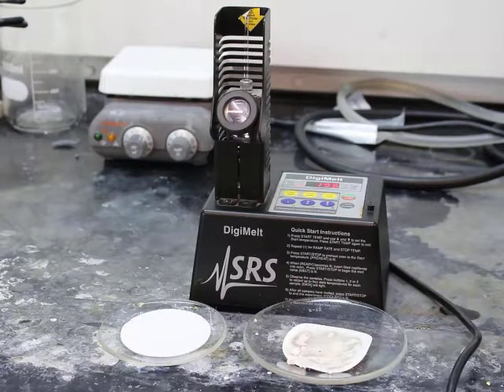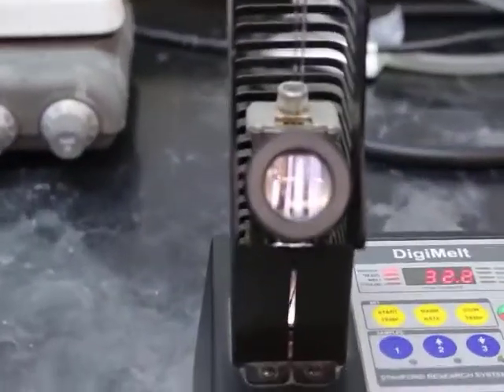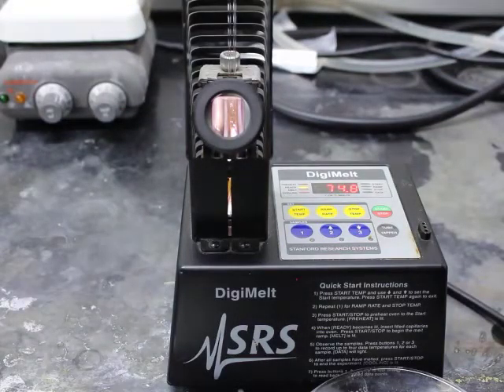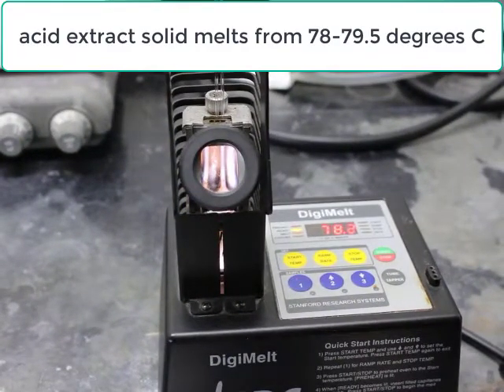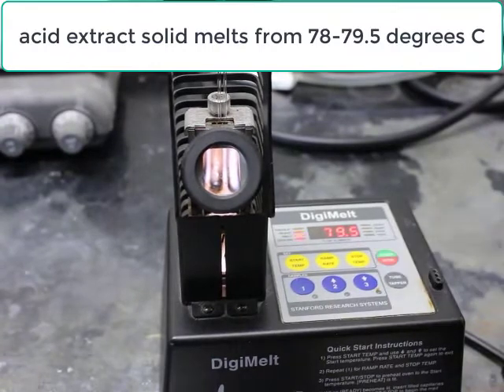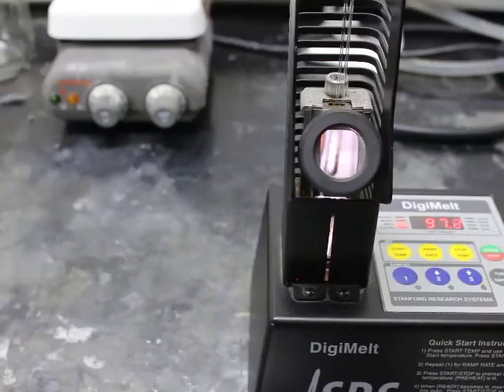And so now setting up this Digimelt, the melting range is going to range from approximately 40 to one of our highest melting points, approximately 205. So going to go from about 30 to 250. We can see our acid extract has already started to melt around 78. Started at 78 and finished around 79 degrees C. You can kind of see it finishing up.